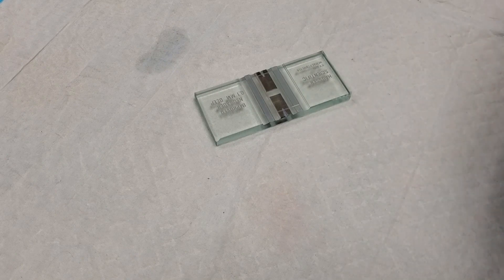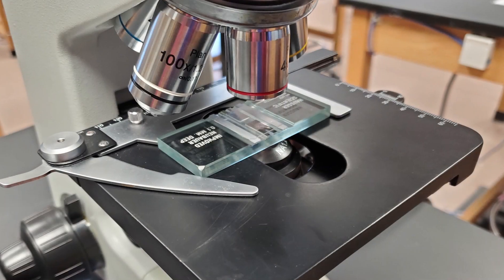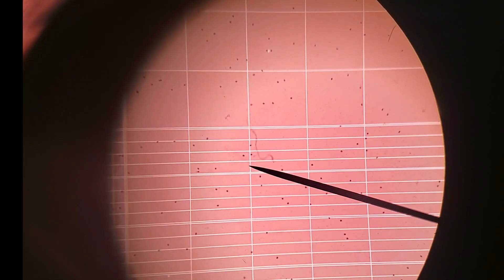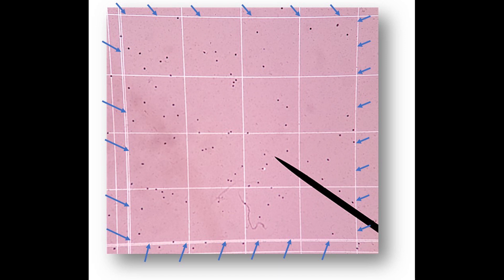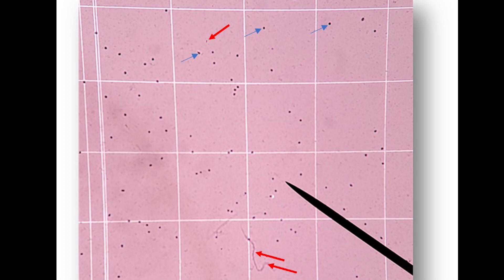To do the total white blood cell count, we use a hemocytometer just like lab 15, loading 10 microliters of blood. You'll notice right away there are a lot fewer dots this time, and the dots you do see are dark and small. We're counting a bigger area — the blue arrows represent the boundary of one of the four boxes you will count. There's a lot of cellular debris, so it's important to distinguish between white blood cell nuclei and debris. White blood cells are shown with blue arrows; ignore the red-arrow debris.